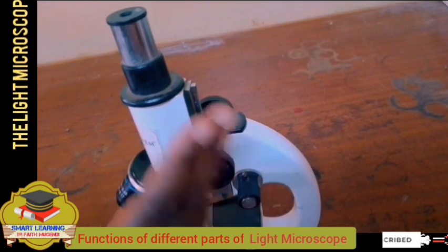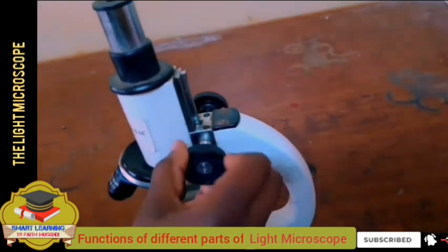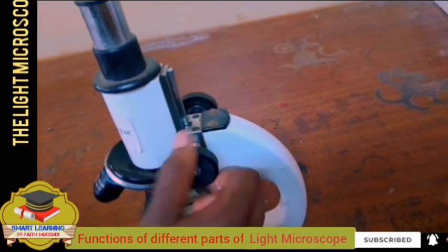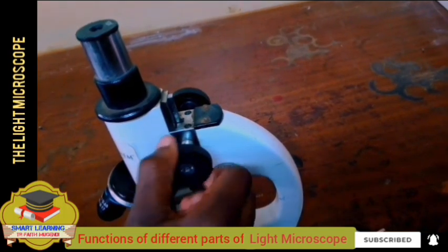We say it brings the object into rough focus. The reason it brings the image into rough focus is that the image moves in and out of focus very quickly, so it is difficult to adjust the focus.